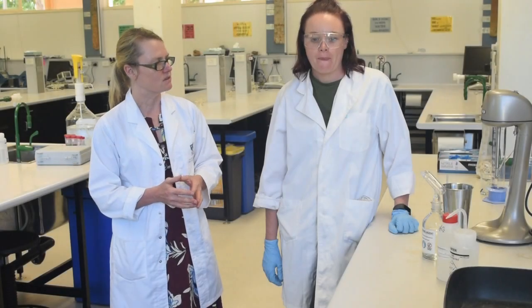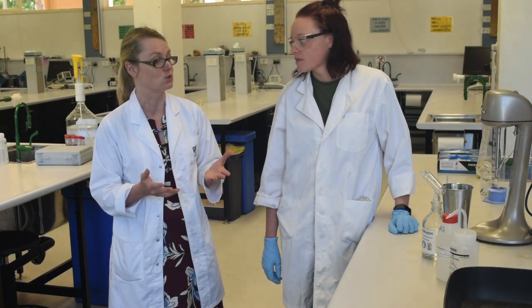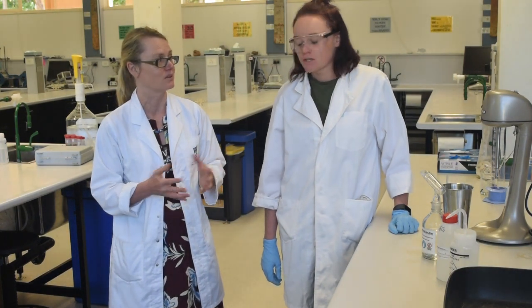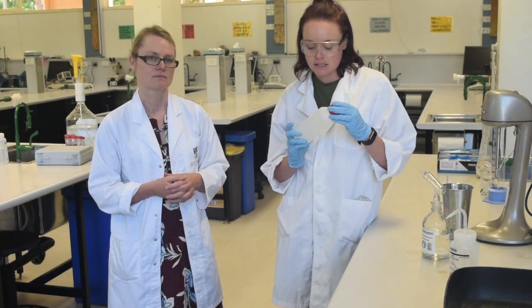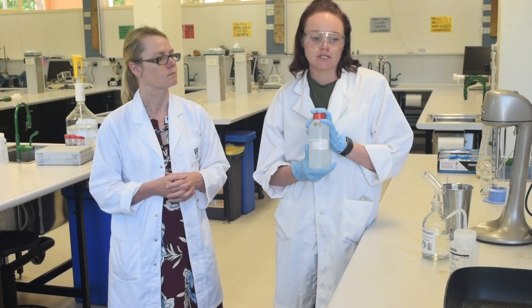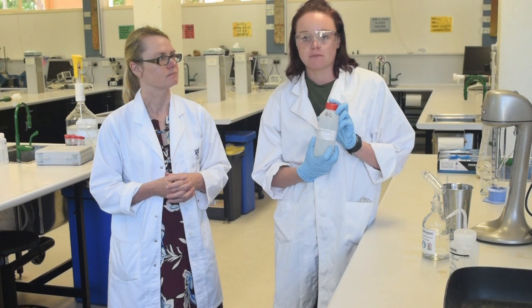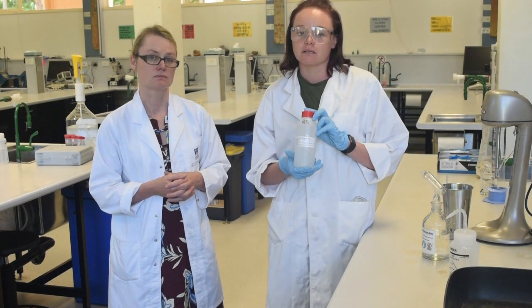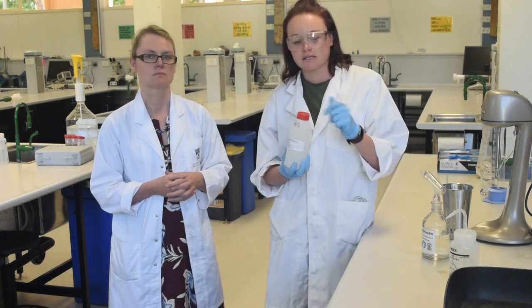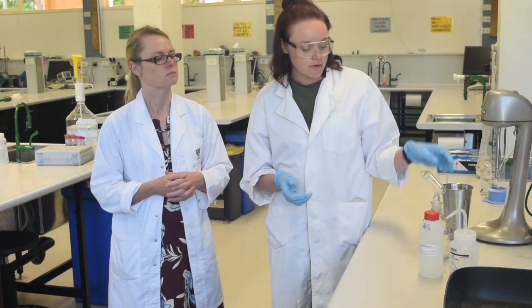So what are the key safety considerations for this lab? There are two main chemicals used in particle size analysis. The first is hydrogen peroxide, which reduces the carbon content in your soils. It's only at 6% but it is still a bleach product, so safety glasses and gloves must be worn at all times when using it.